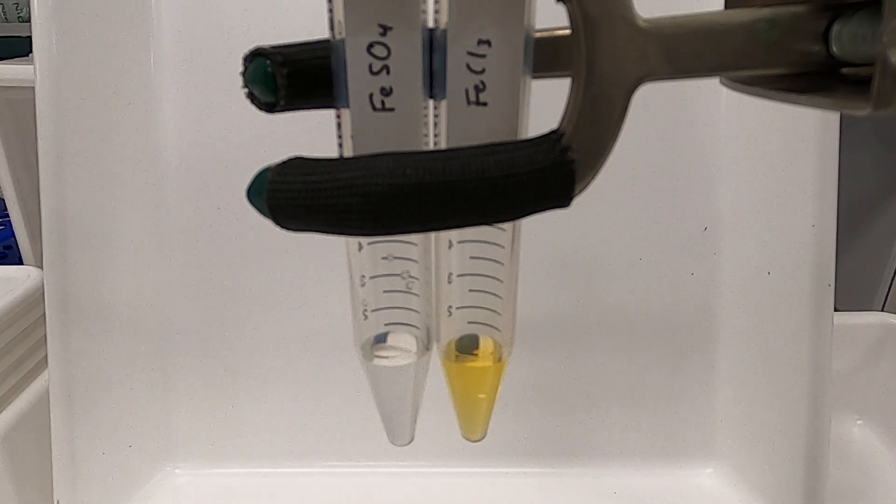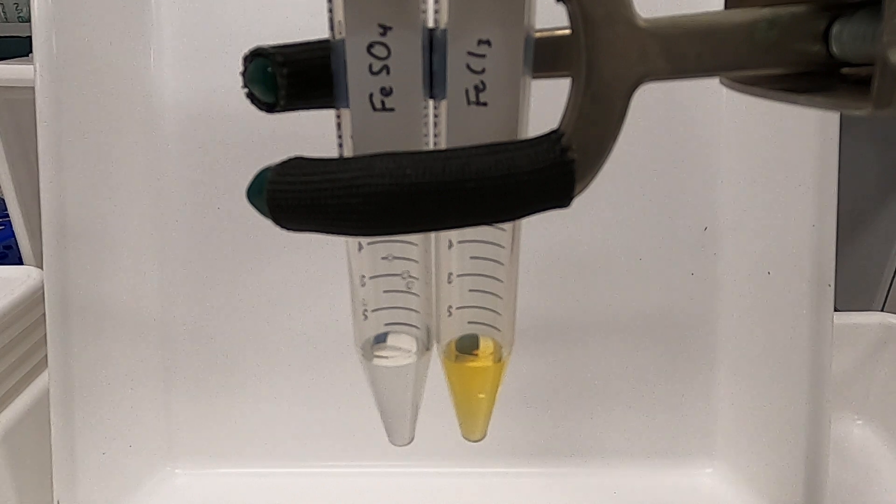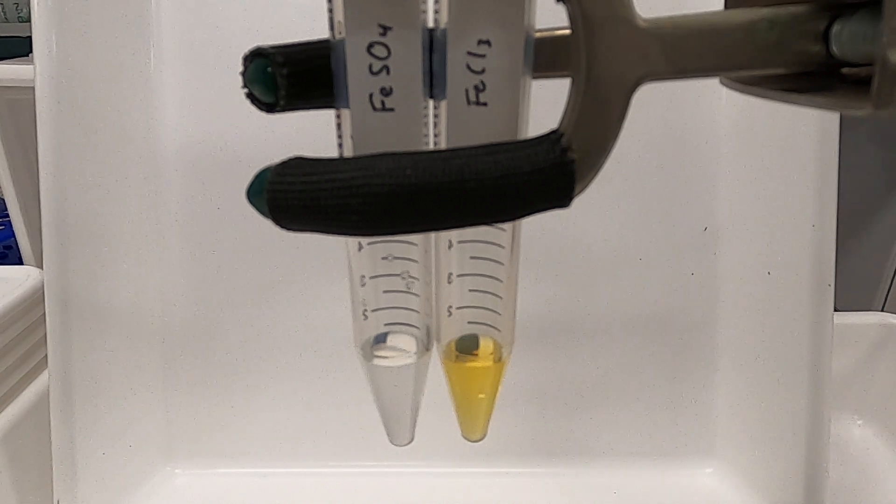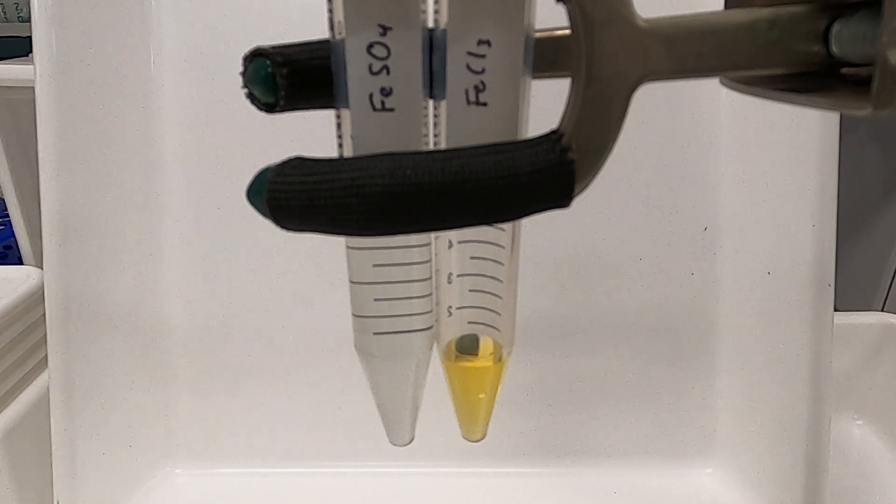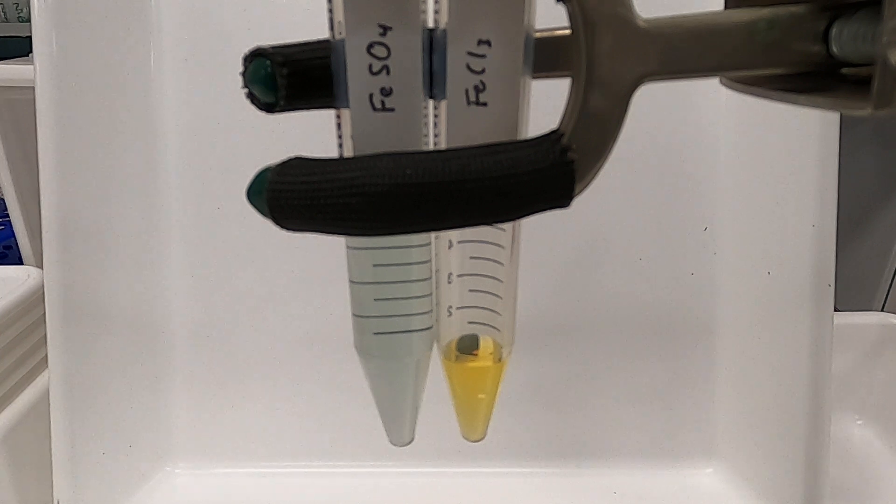So what we're going to do now is add a buffer solution which will raise the pH. We make the assumption that the buffer does not participate in any reaction other than by controlling the solution pH.